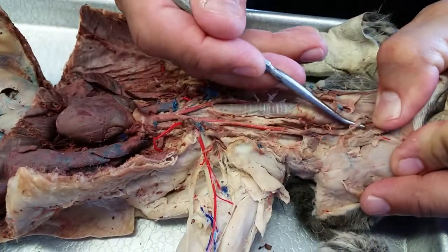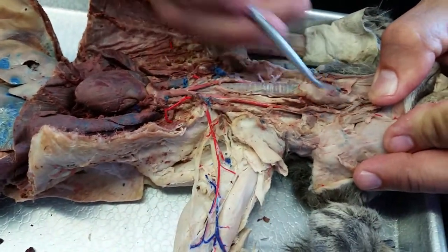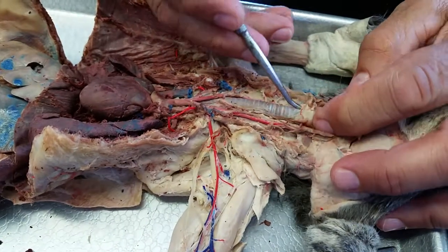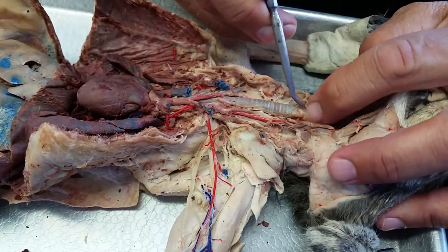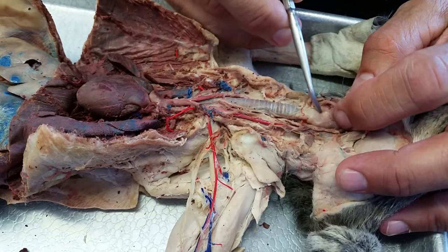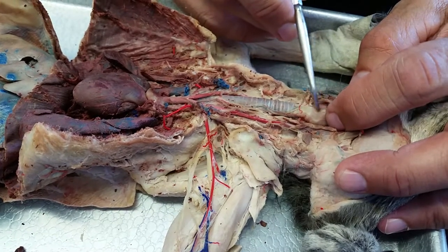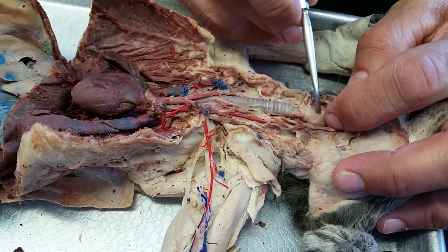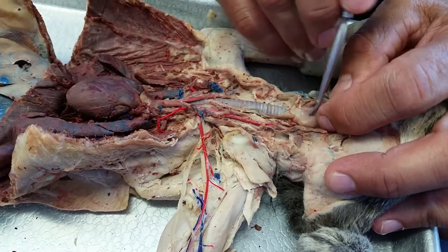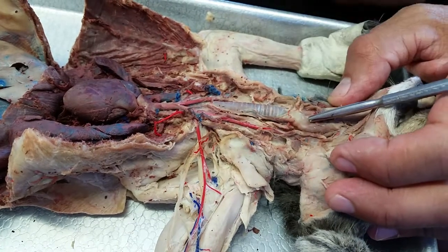Here's your hypoglossal right here. See the white? That's the hypoglossal nerve. Right here we know this is our — what's that? The trachea. So here would be thyroid cartilage, right? Cricoid. If we go in here, we make a trach. See? Trach on the cat.